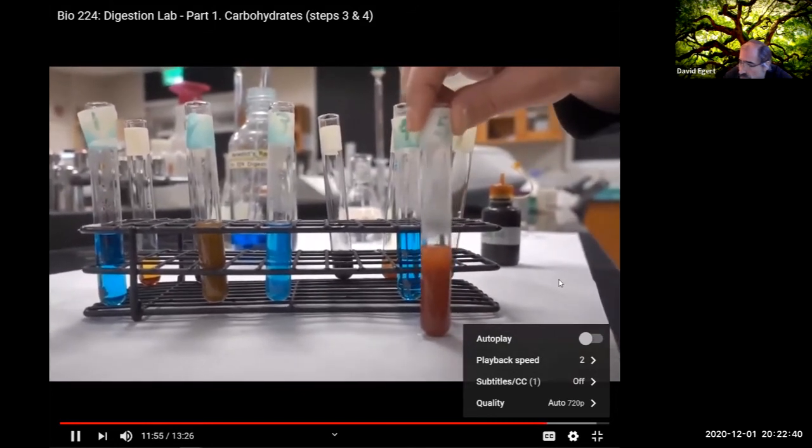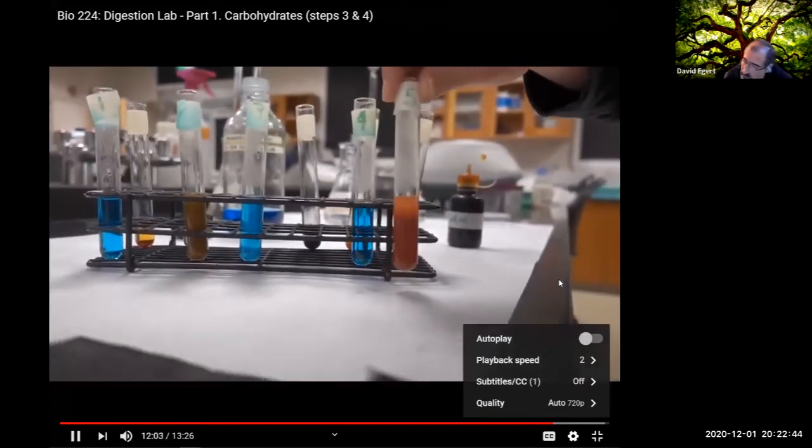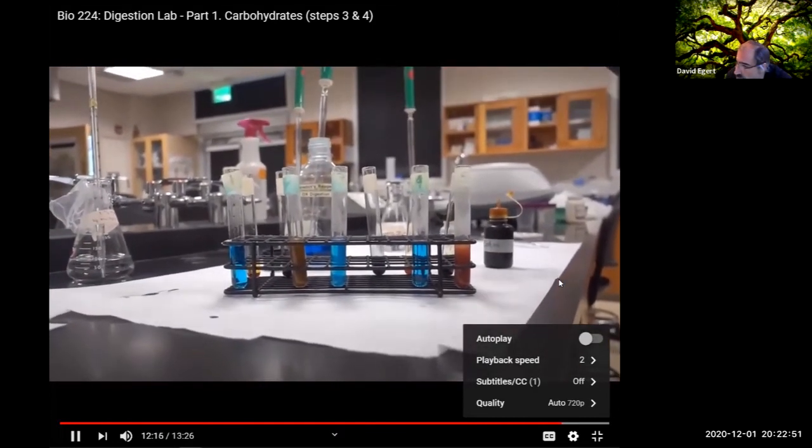This would be a very strong positive reaction with Benedict where it turns this reddish orange. Again, there's a whole range of colors it can turn. It can turn from kind of greenish all the way to this kind of tomato red orange, and that would all imply the presence of maltose in our case here. So this is great from our control perspective. Starch was negative for maltose, maltose positive for maltose.